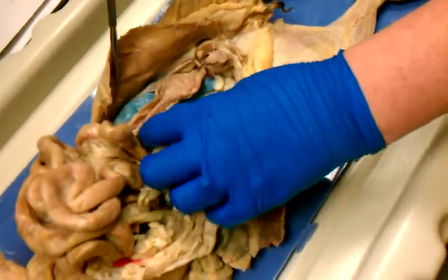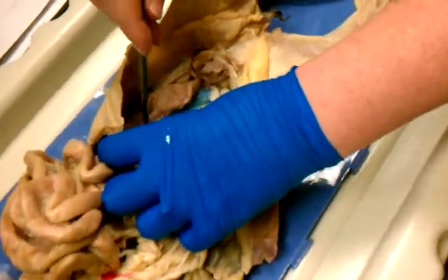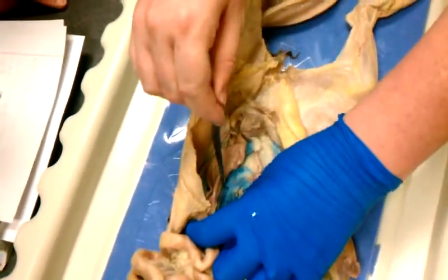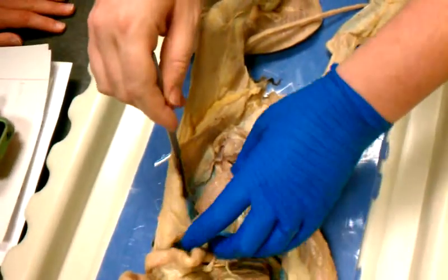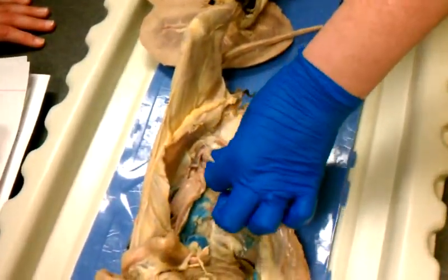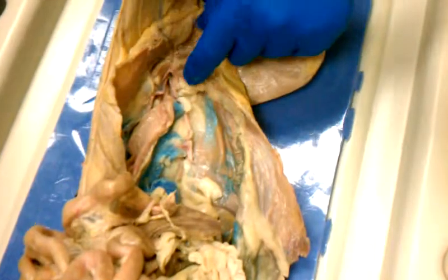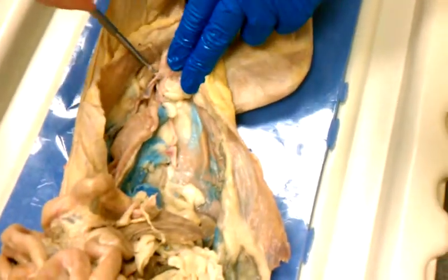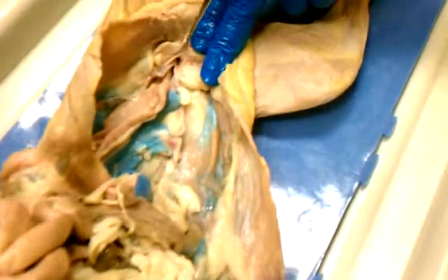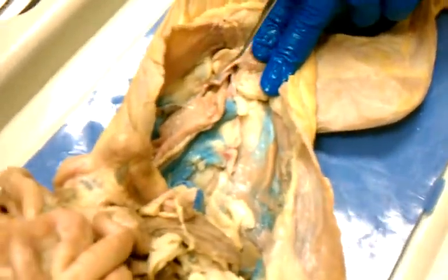So kidneys make urine. Urine is drained into the ureters, right? It's kind of hard to see here. They're all buried in this adipose tissue. But if we go down to this pouch, which is the urinary bladder right here, you can see the 2 tubes connect to the urinary bladder right here and right here. So here are your 2 ureters.